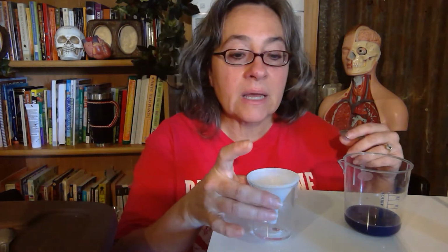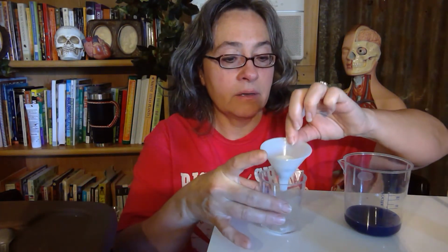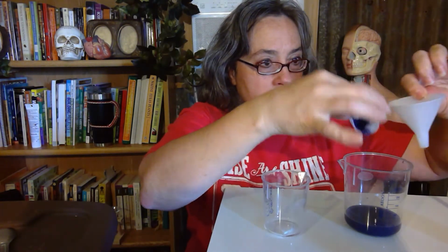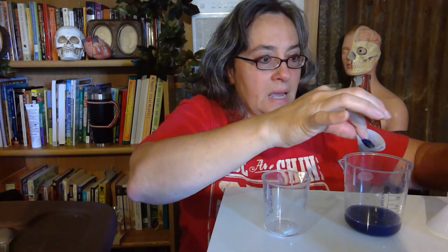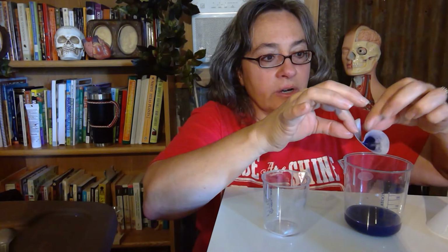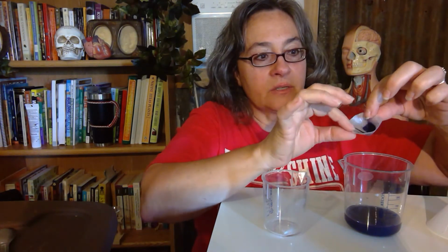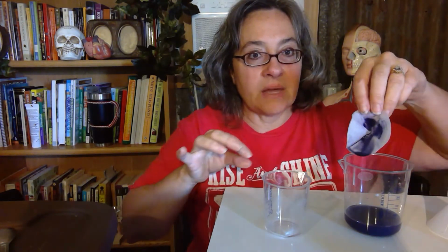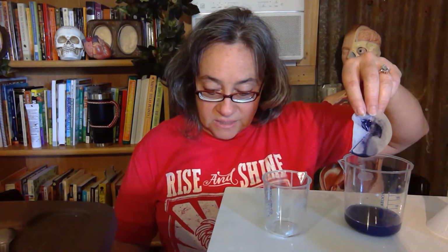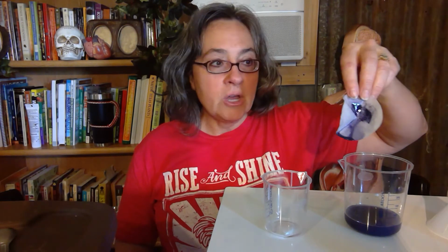And then it looks like it's almost done. I'm going to take it out and pour out the extra there. And look at the paper. The starch had to go somewhere. It's not in beaker 1, so it's on that filter paper. There's the starch. So for observation of contents after filtration on the filter paper, you can put kind of a purple sludge is what it looks like. So purple sludge, S-L-U-D-G-E.